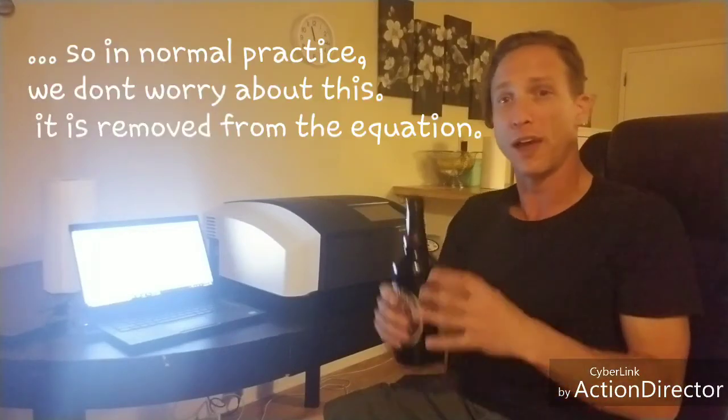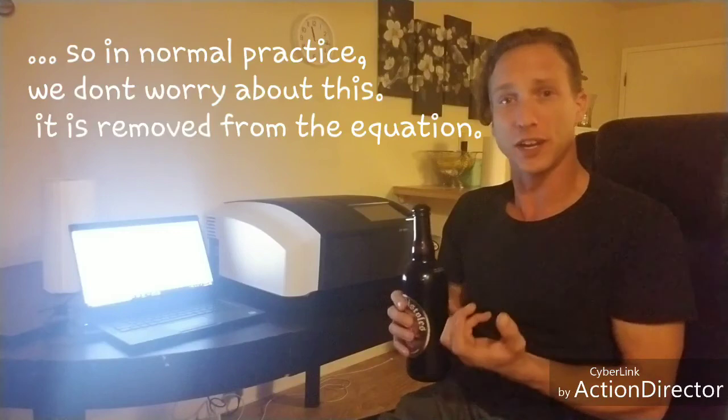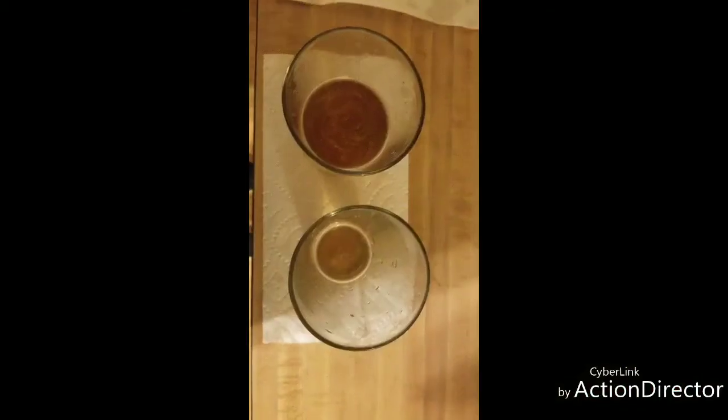It's just not going to work. But I can compare the Corona to itself, or I can compare the IPA to itself, which is what I'm going to show you. So that would be your molar absorptivity constant, and that's just dependent on how the molecule is going to absorb the light passing through. And all molecules are going to do this differently.